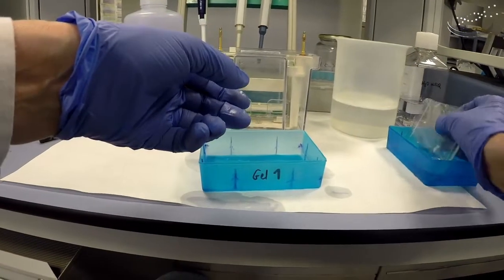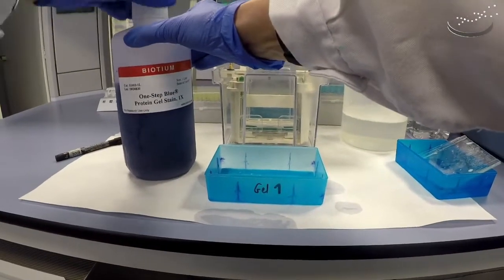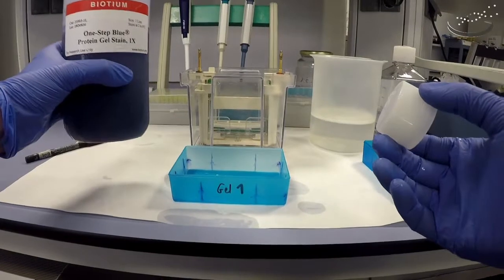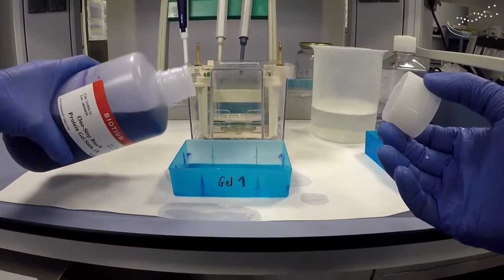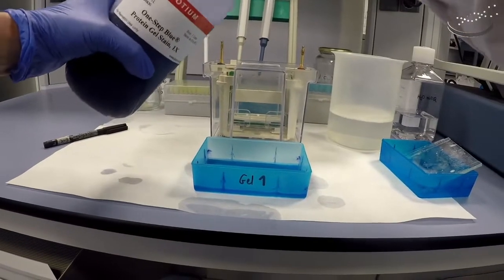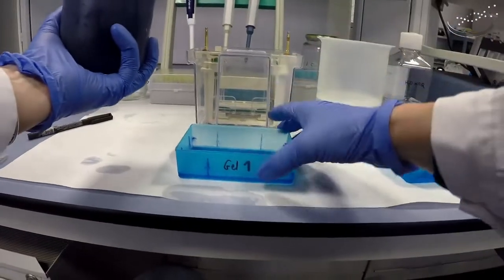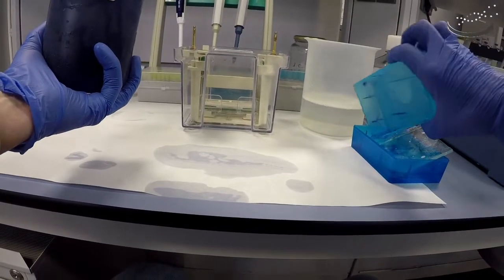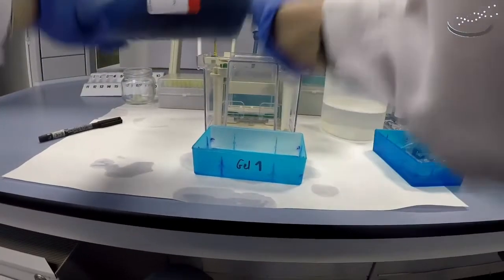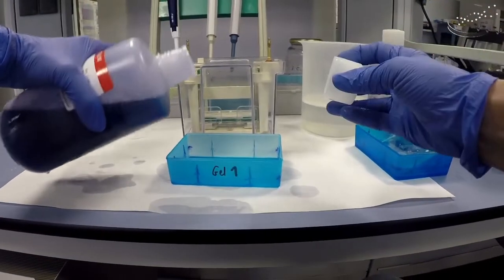We'll keep the plates aside to wash later. We're going to use a staining solution — in this case it's called One Step Blue, though you can also use Coomassie. We apply the One Step Blue stain onto the gel, but we can see right away that it wasn't mixed well enough, so we discard that solution. We invert and mix the solution very well, then apply the properly mixed solution to our gel, which will stain much better.